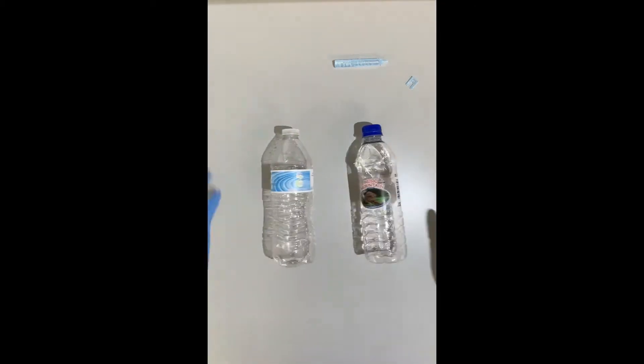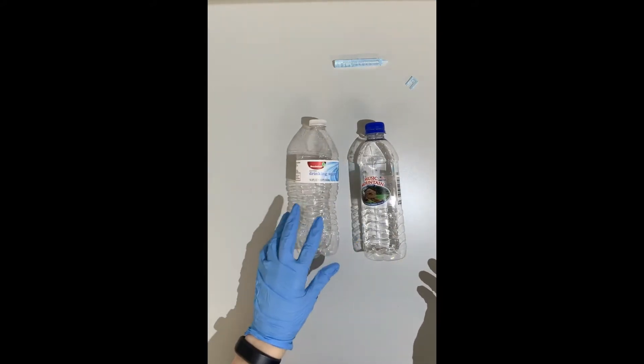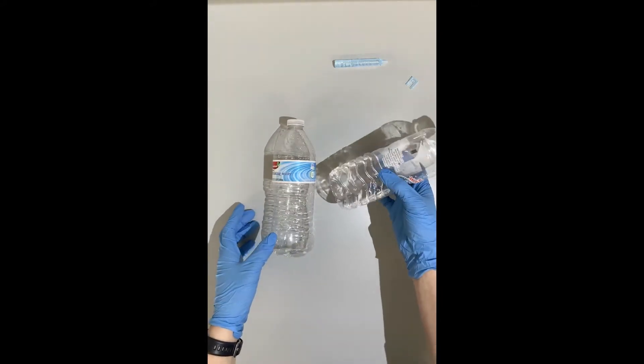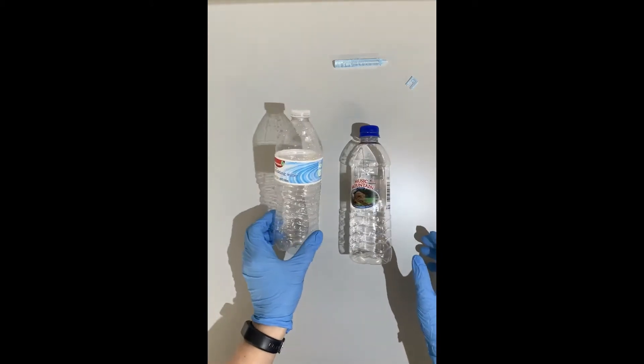Today our case scenario is that we have a burglarized vehicle and there are two water bottles found in the cup holders. One has a small amount of liquid in it and one is empty.